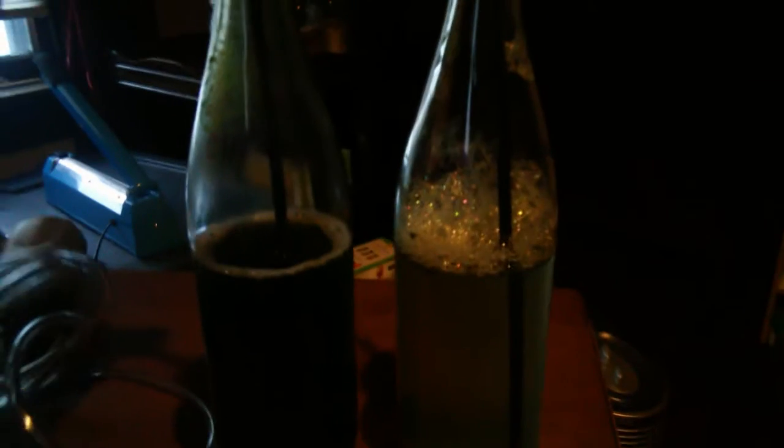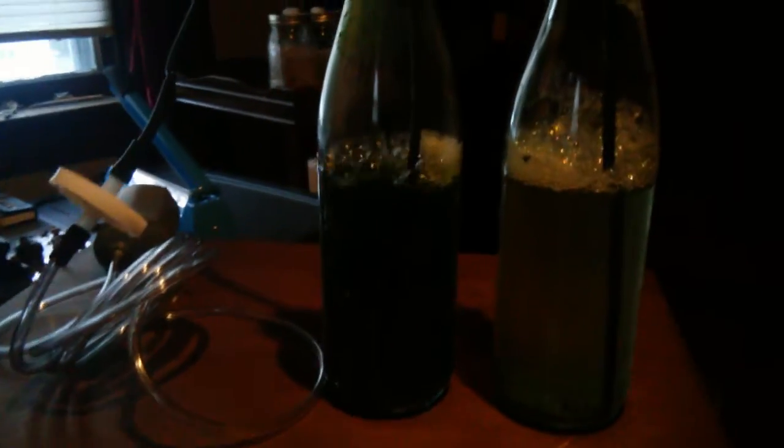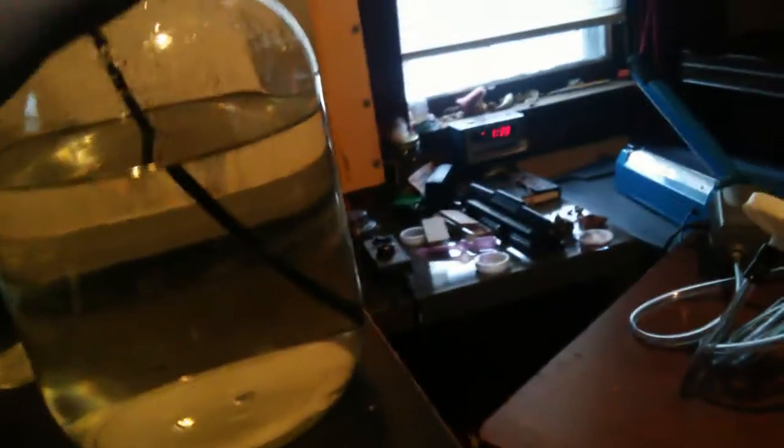I have the air pump going through a HEPA filter — it's on. I can disperse the microalgae cells in the bottles before introducing them into the new photobioreactors. I'm using sterile methods, and I've got the bernzomatic torch here to sterilize the tops of the containers before I transfer the cultures out.